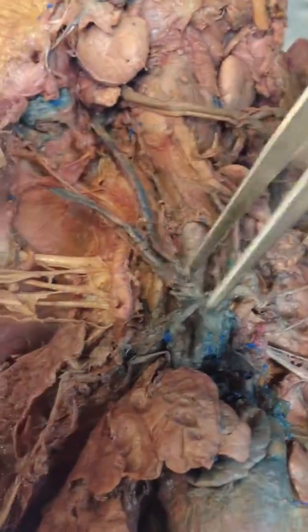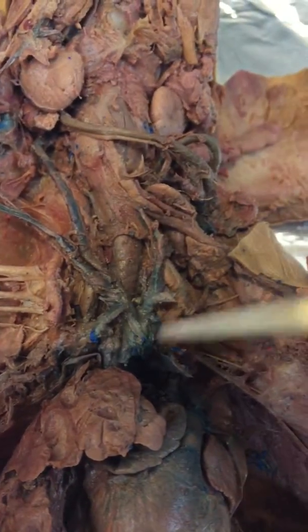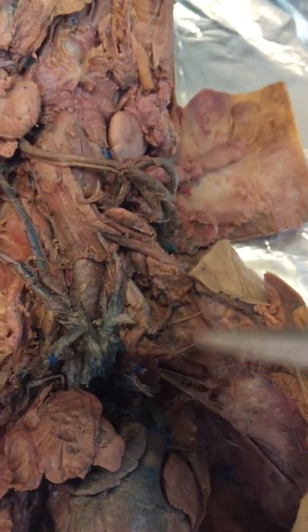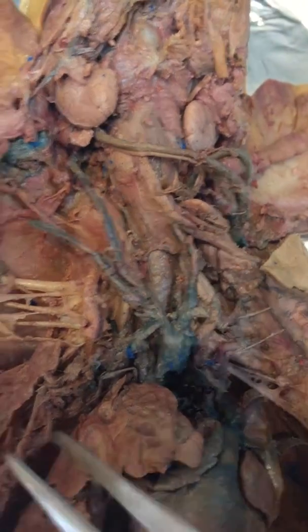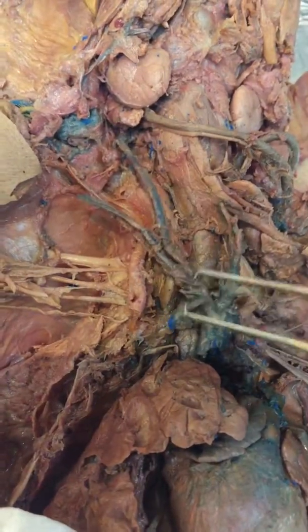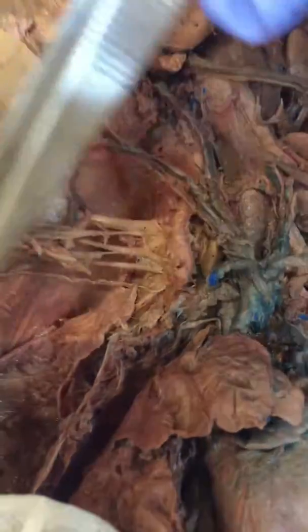However, here's what I do know, and I know it should have been coming off the subclavian vein, because the cephalic vein drains blood from the superficial surface of the arm, and it actually drains it into the axillary vein, and the axillary vein becomes the subclavian vein. So for example, here's the right one. So anyway, it should have been in this area. I think I just might have severed it, but I wanted to let you know that I know its function and what it drains into.